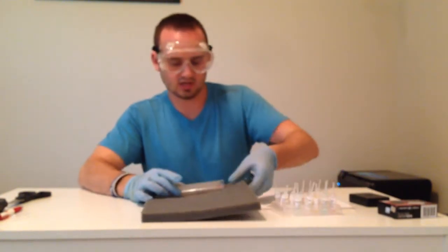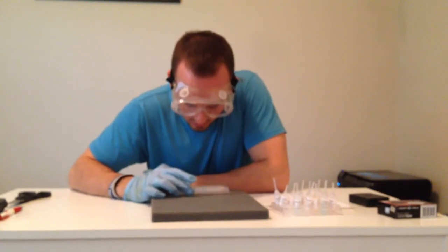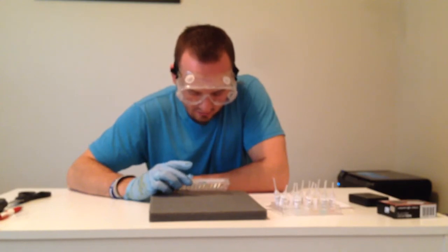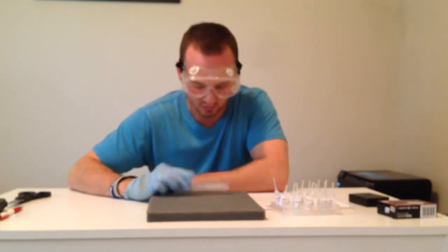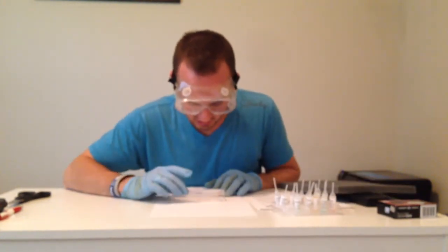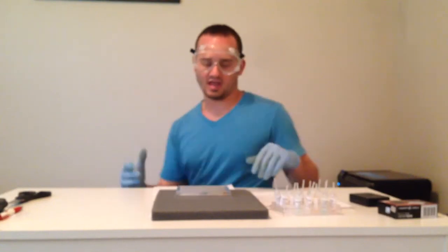Immediately, looking at this on black paper versus white paper, you can tell a huge difference in the precipitate. It looks like actually the entire 4th through 7th column on every single reaction, we've got a ton of precipitate. And also the 1st column is pretty reactive as well. Look at it under the white paper, and you can see a ton of color change. But being that this is clear and the paper is white, it's kind of hard to see where the precipitate is. Actually, let me grab the camera and I'll let you see this.